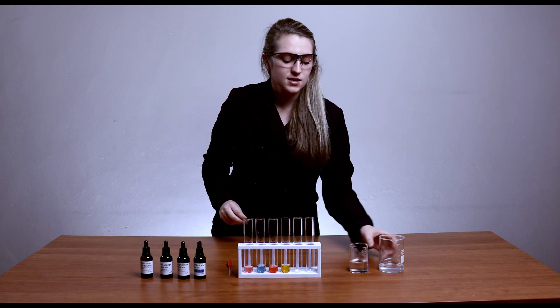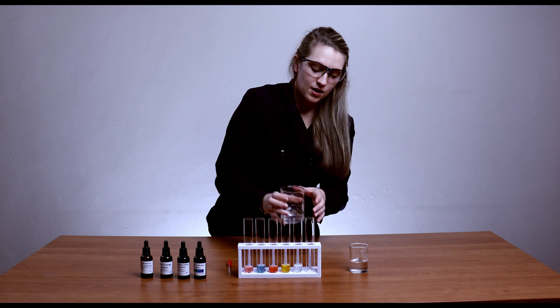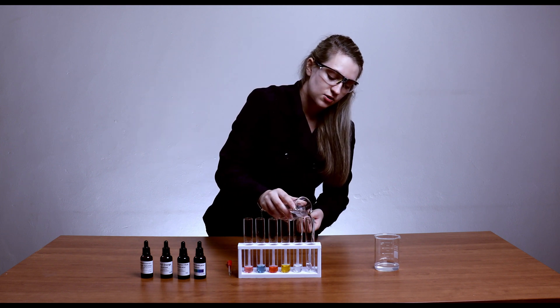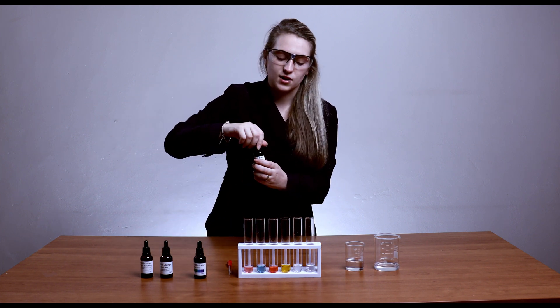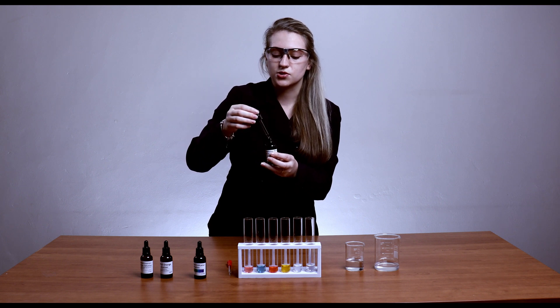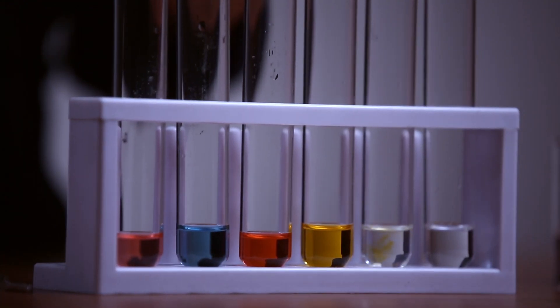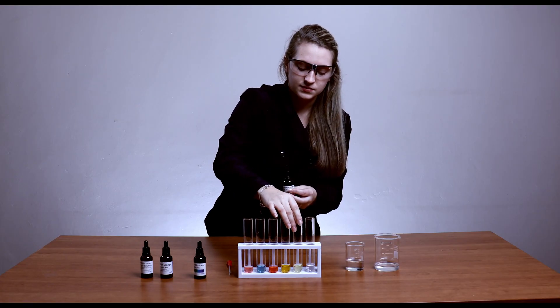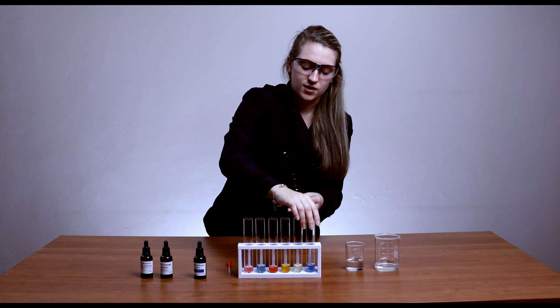The next indicator I'll be using is bromothymol blue. We normally use bromothymol blue when we titrate a strong acid with a strong base — for example, sodium hydroxide against hydrochloric acid. Bromothymol blue should go yellow in an acid and blue in a base. You can see that's a nice yellow color in the acid, and it goes a nice dark blue in the sodium hydrogen carbonate, showing that you've got a base.